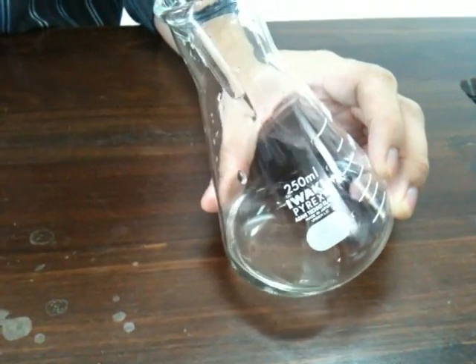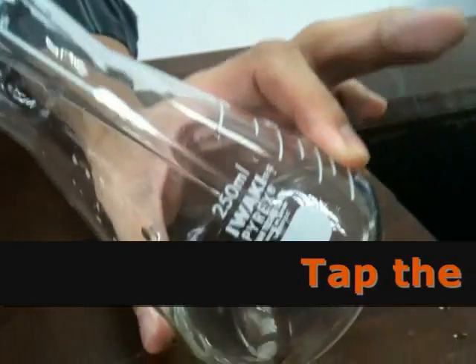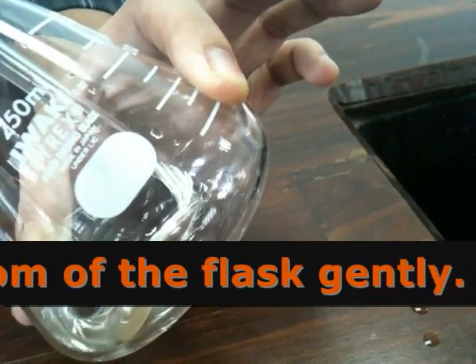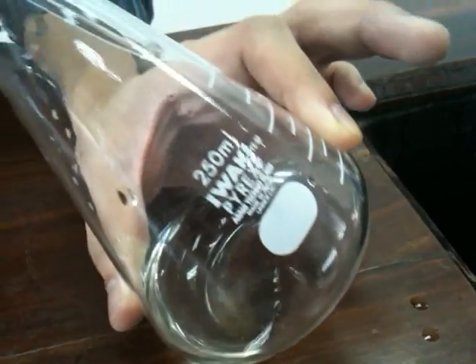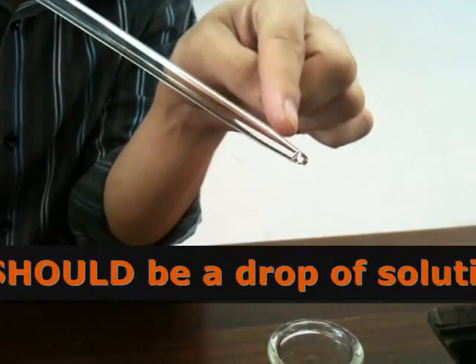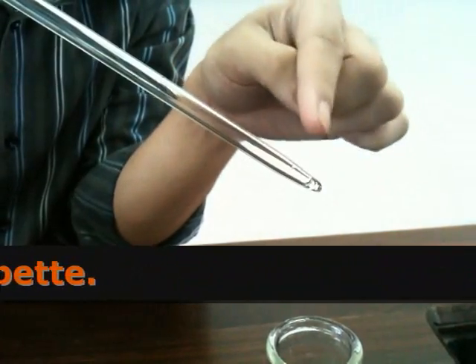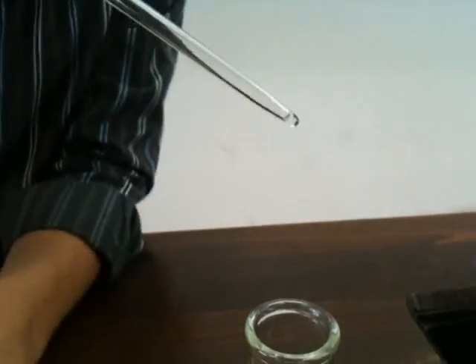Allow the solution to come out of your pipette. After you've drained most of it out, you'll find there will still remain a drop of solution inside. The way to remove it is by tapping the bottom of your pipette against the wall of your conical flask. Whatever remains in there is meant to be there — it is already accounted for in the calculation of your 25 cm³ — so do not try to remove all of it, just remove most of it.